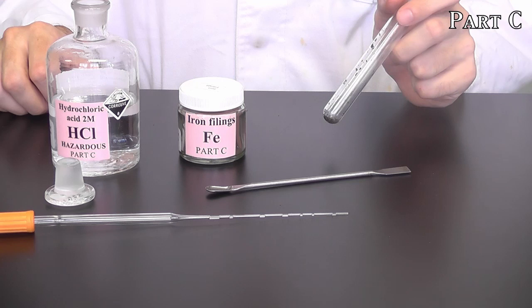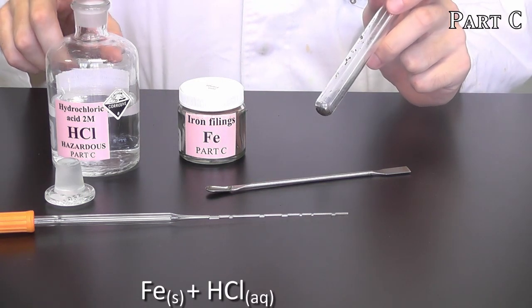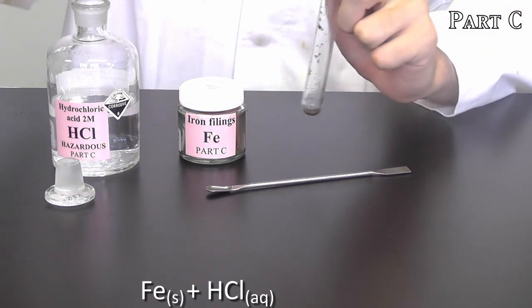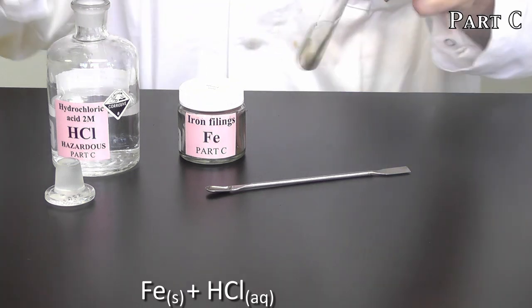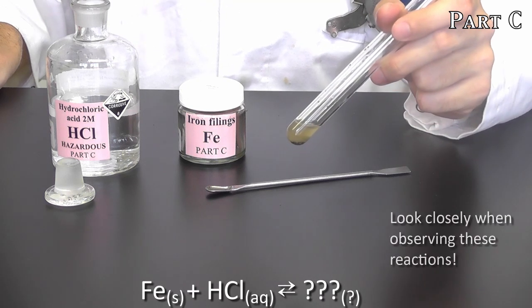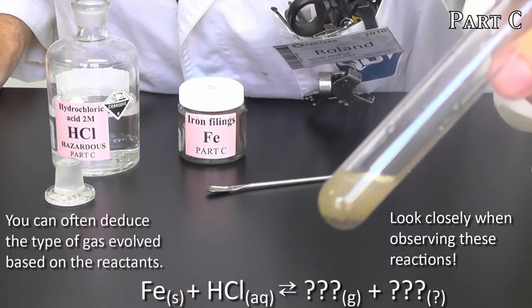To show you an example of what we expect with these redox reactions, I have an example here that will use iron filings, which I've already placed some of into this test tube, as well as some hydrochloric acid. It's about 2 molar. So to the iron filings, I'm going to drop in some of this hydrochloric acid and observe any changes. And I want to make sure they're covered entirely, and I'll just give them a bit of a shake. And I can see that immediately there is a change to a sort of brown color. And I'm not sure if you can pick that up on the camera, but there are a small amount of bubbles evolving as well. So there's some kind of a gas being produced in there.